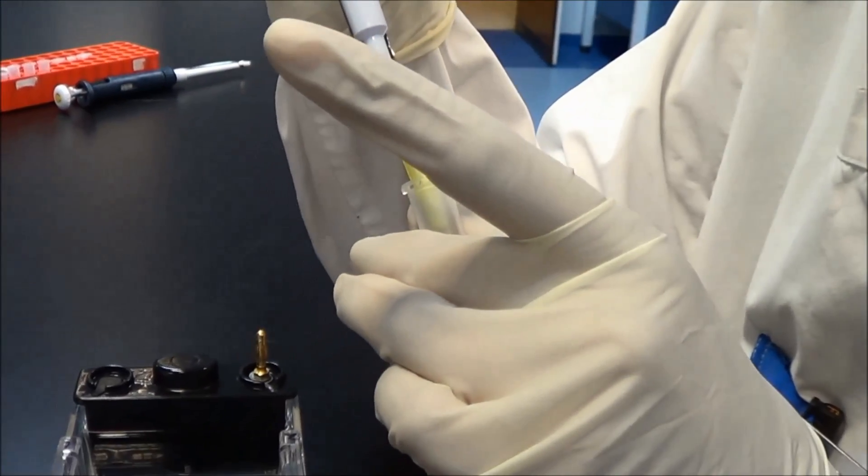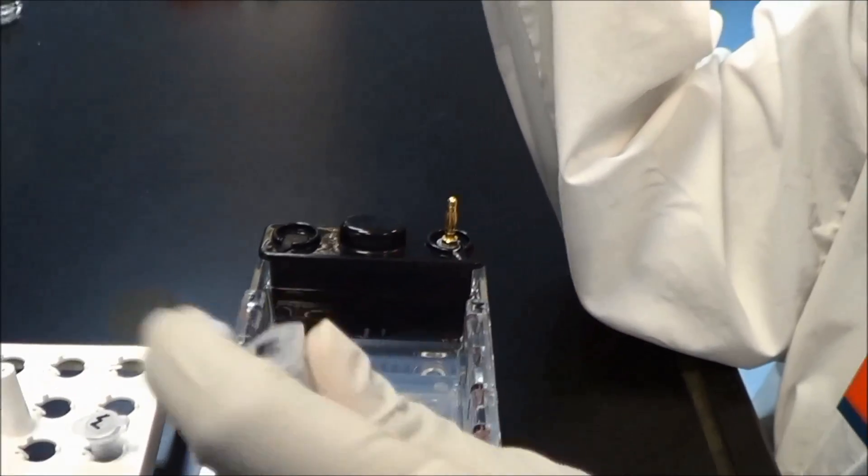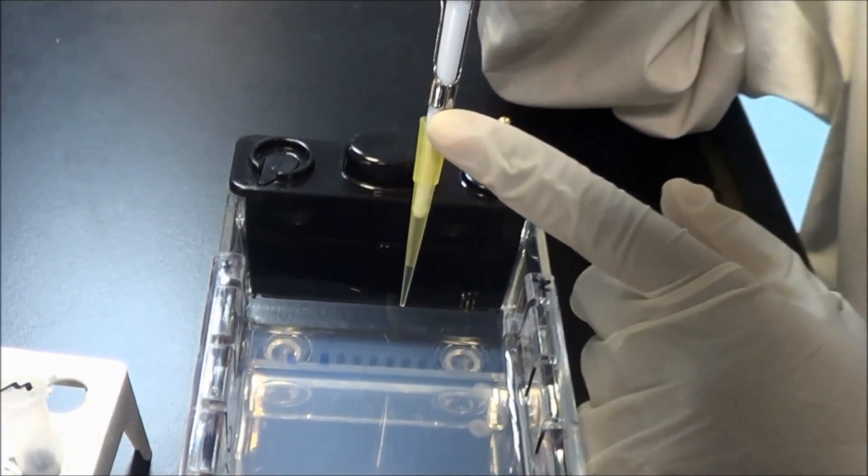Very carefully load the sample into the wells on the gel. Be careful not to puncture the gel at the base of the wells.